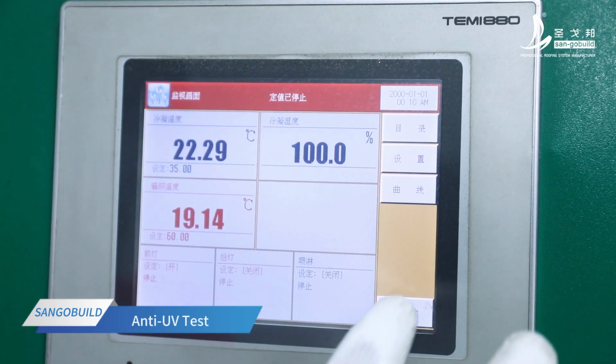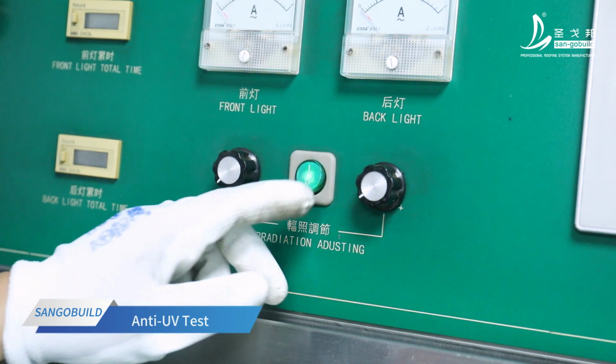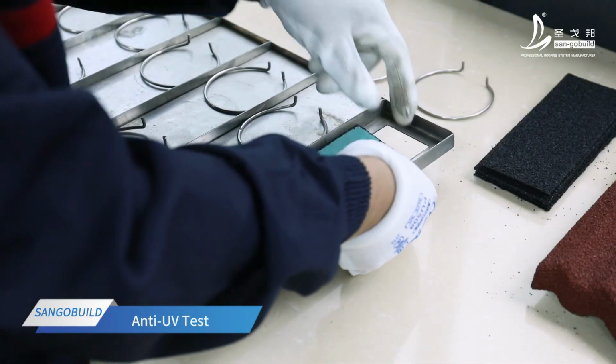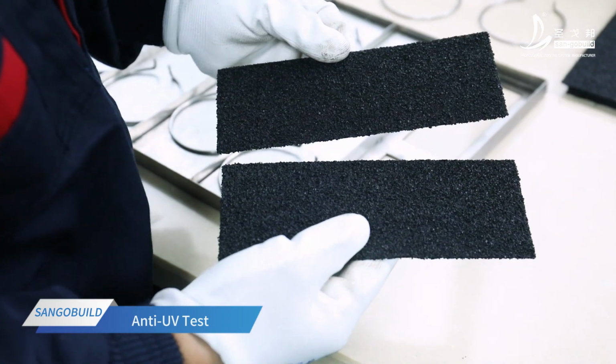After a period of testing, the laboratory technician compares the sample with the untested sample. The sample of stone-coated roof tile has no aging and fading after simulated strong ultraviolet radiation. Pass the test of UV resistance.